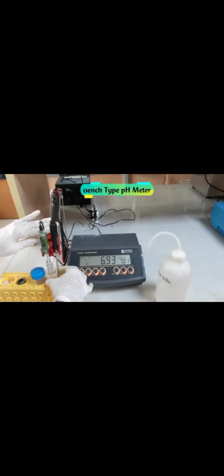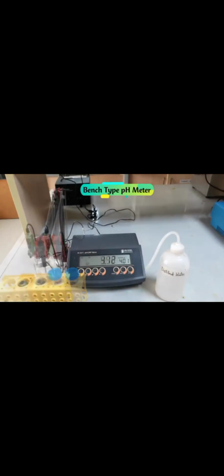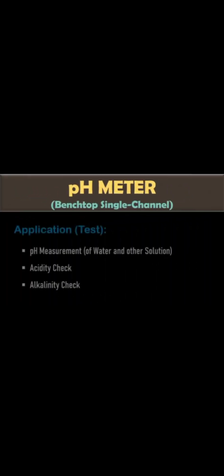As you all know, the pH range is from 1 to 14, and pH 1 to 6 is considered acidic, while pH 8 to 14 is considered alkaline, and pH 7 is neutral, which is mainly the pH of distilled water. So pH meter is mainly used to check the acidity or alkalinity.